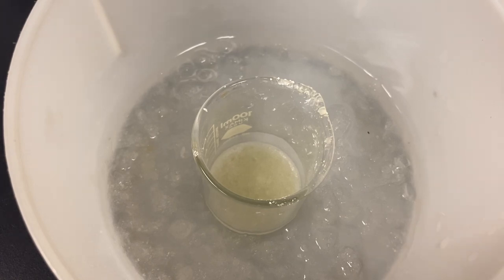After this, we're going to take a pre-weighed filter paper, use that in a Buchner funnel, and we can filter this off. We'll leave it on the Buchner funnel for a little while.